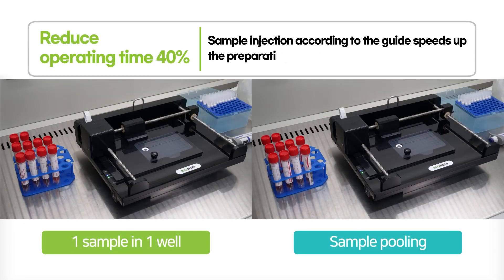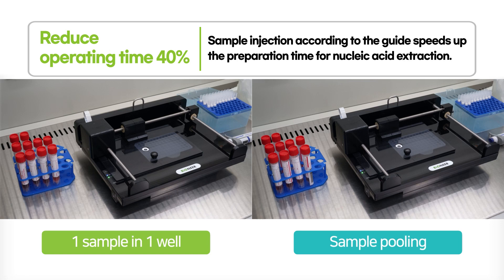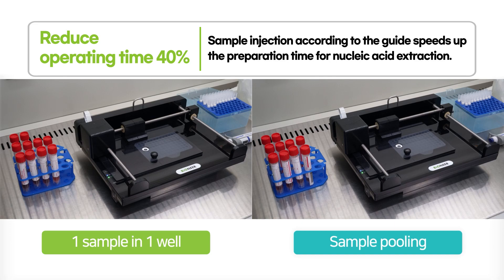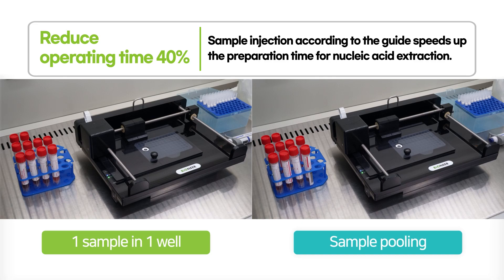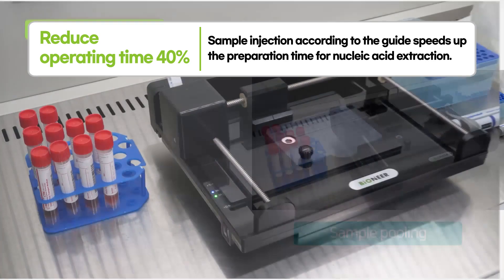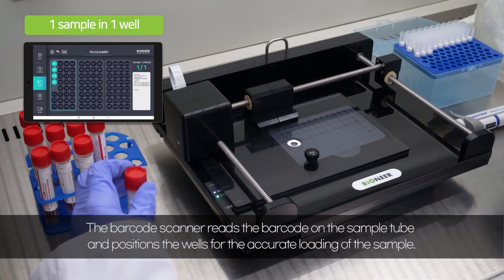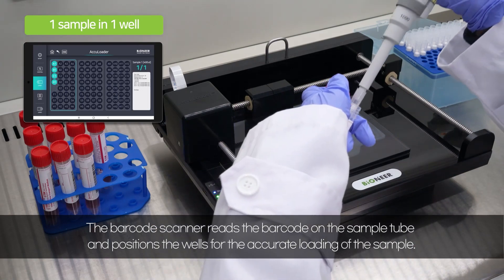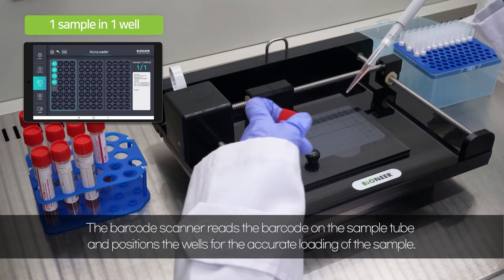AccuLoader reduces operating time by 40%. AccuLoader automatically guides the sample injection to reduce preparation time for nucleic acid extraction. For one sample per well, the barcode scanner reads the barcode on the sample tube and positions the well for accurate loading of the sample.